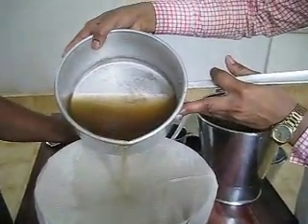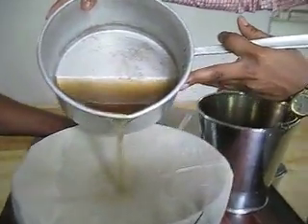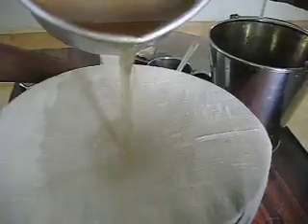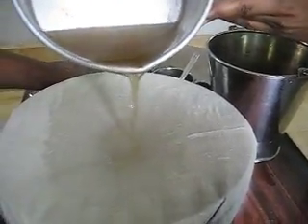For the 21st, all that we need — Doctor, you can make the comment yourself — no particles are needed. That is the idea. And here this is totally clear. It's as good as putting water. Hardly any particles can be seen.